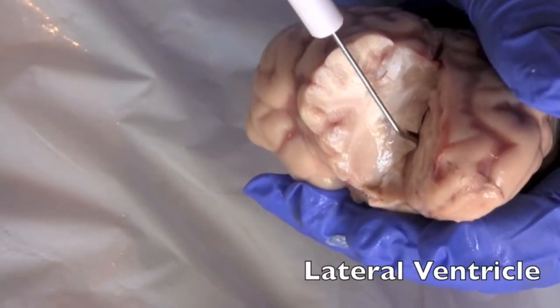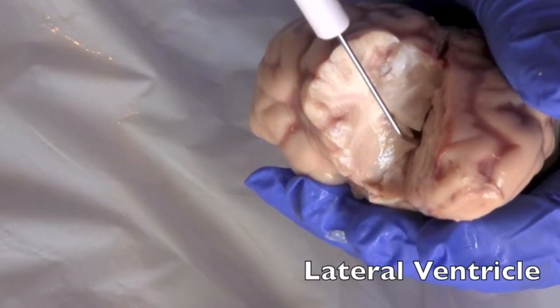So right in here we have the lateral ventricle, which holds spinal fluid throughout the brain.